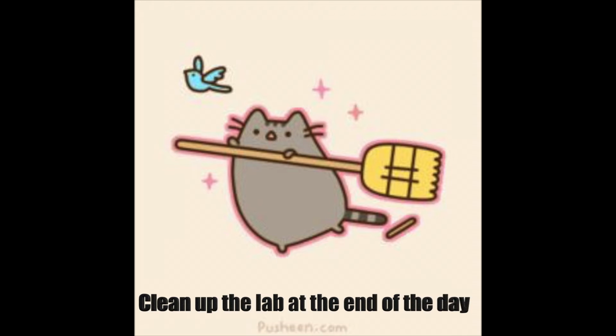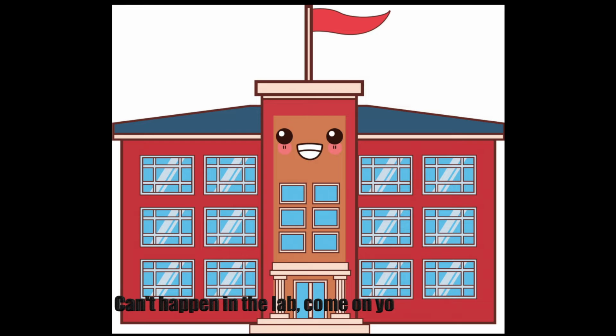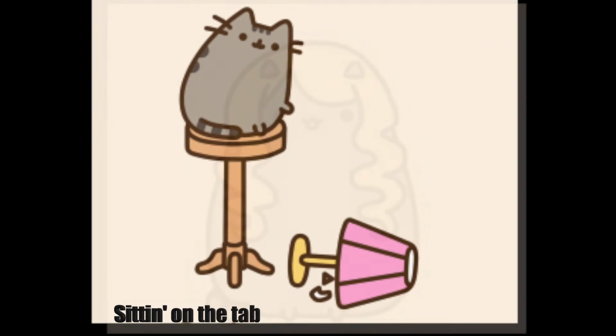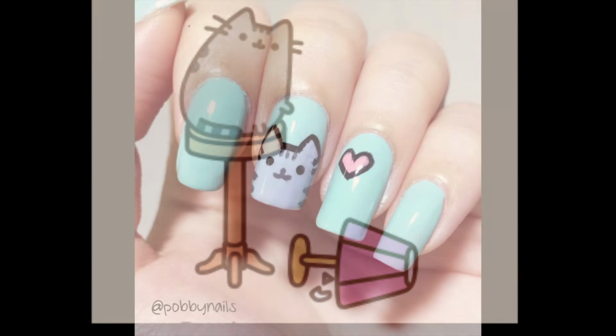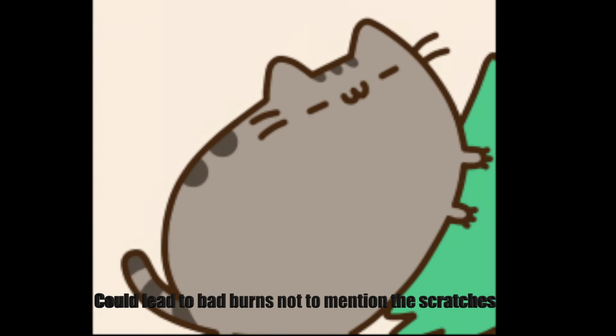Lab at the end of the day. Jumping around and playing like a fool can't happen in the lab. Come on, you're in school. Hanging in the lab, open toes and long hair. Sitting on the table just shows you don't care. Wearing fake nails and playing with matches could lead to bad burns, not to mention the scratches.